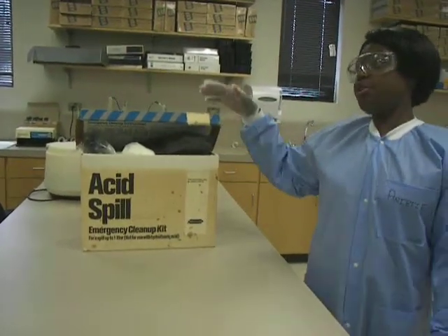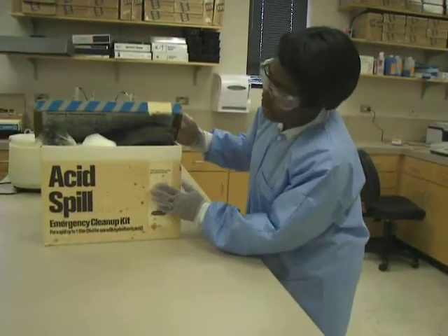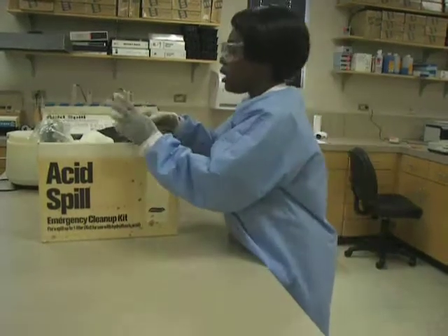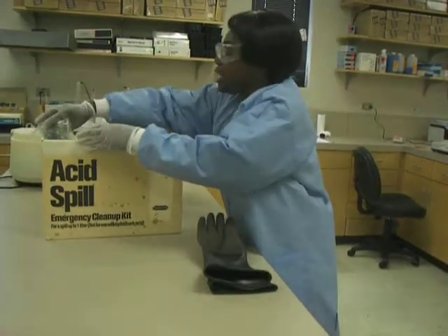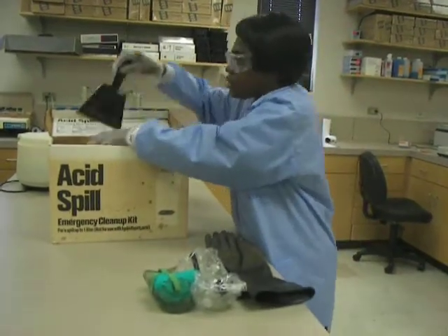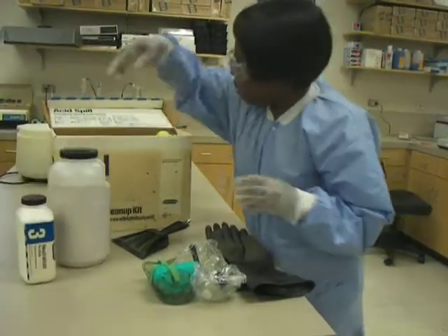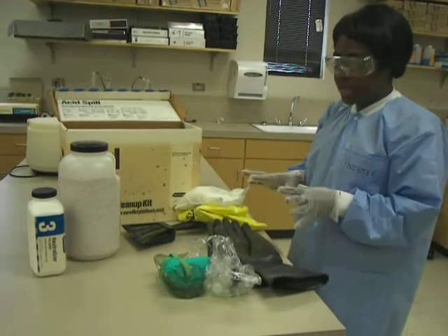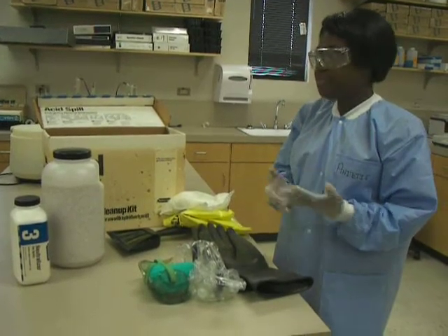The next thing is to locate your chemical spill kit. This chemical spill kit is the one that is available for acid spills. Make sure all the things that you need — your personal protective equipment — are all in there, and that you have all the equipment you need in case of any spill. Check if everything is in good condition, because poorly maintained equipment can cause accidental spills and even explosions.